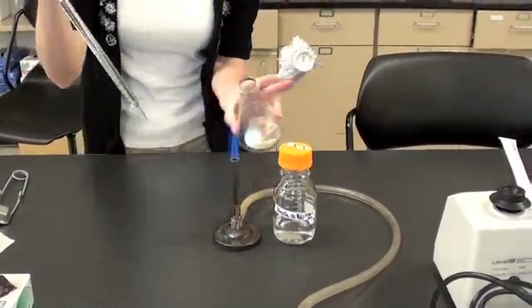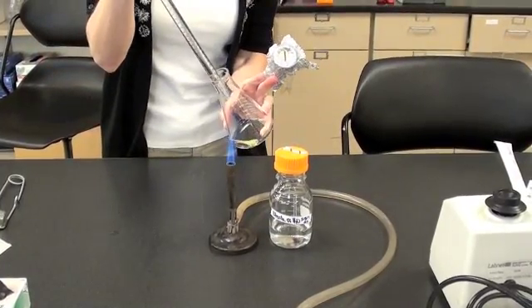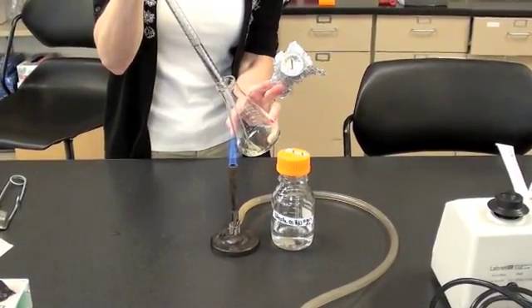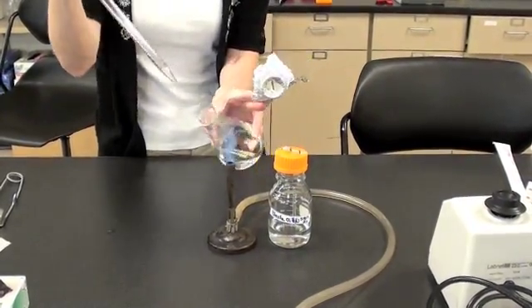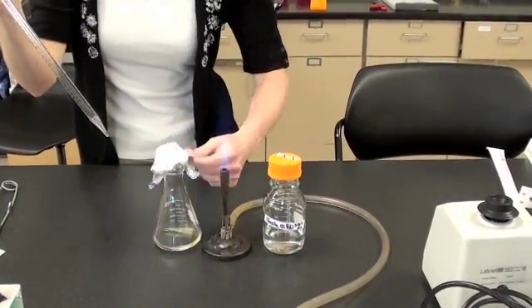Repeat the process on the other vessel. The insides of both of these vessels are sterile as long as you work aseptically. Flame the vessel and replace the cap.